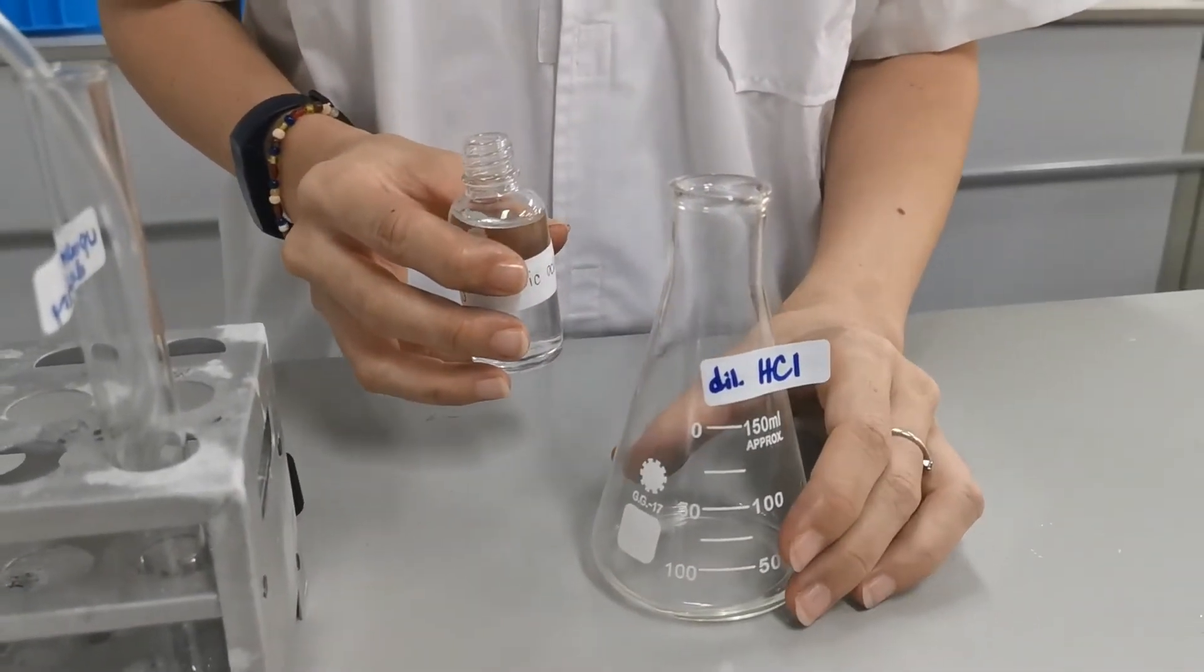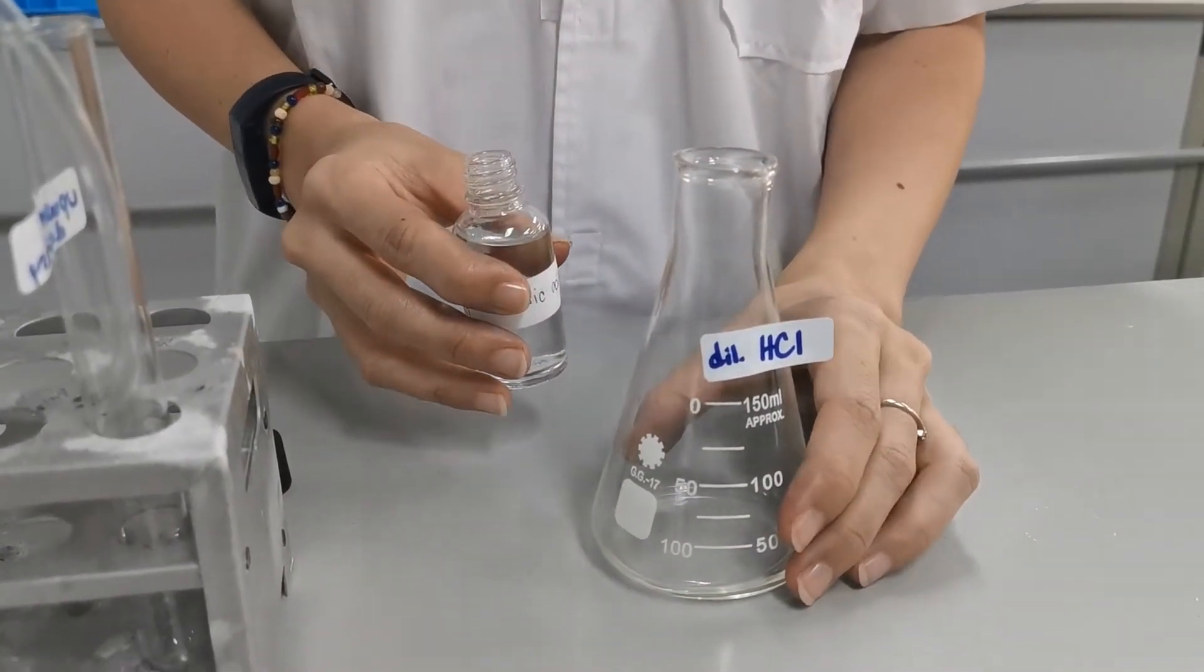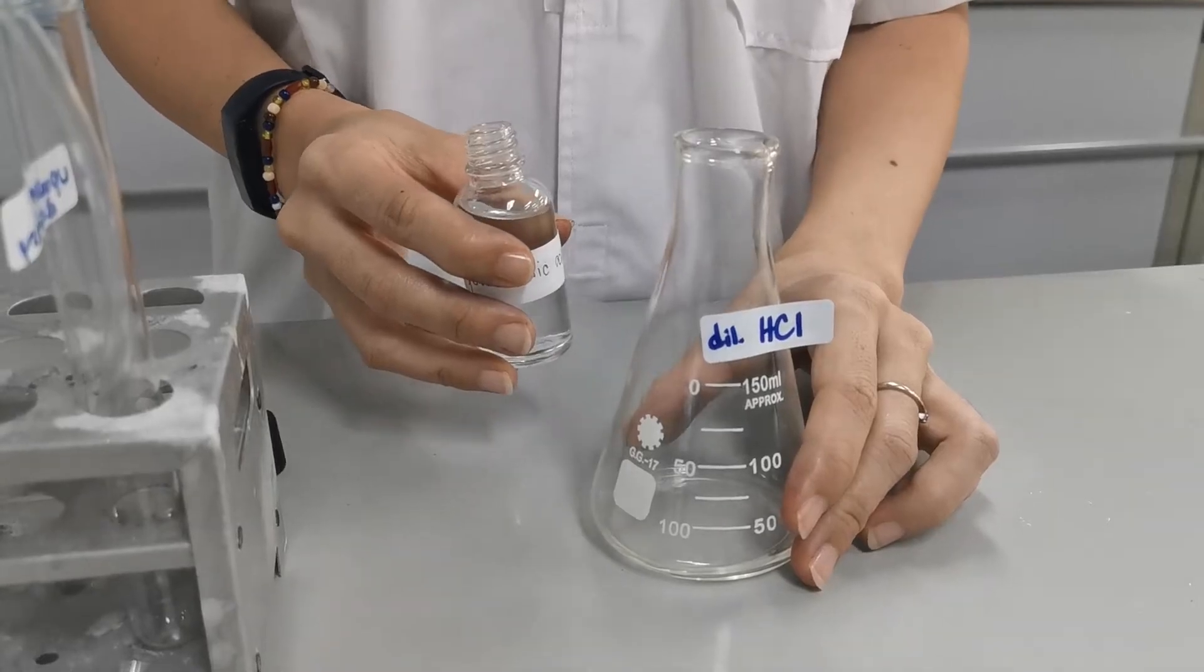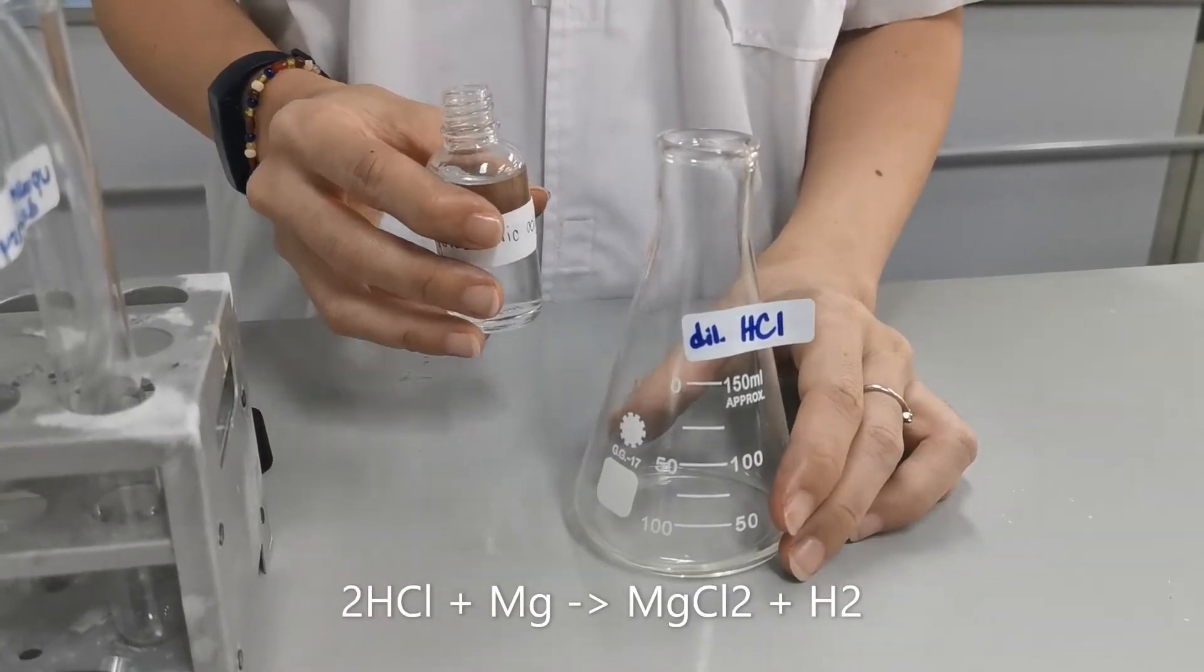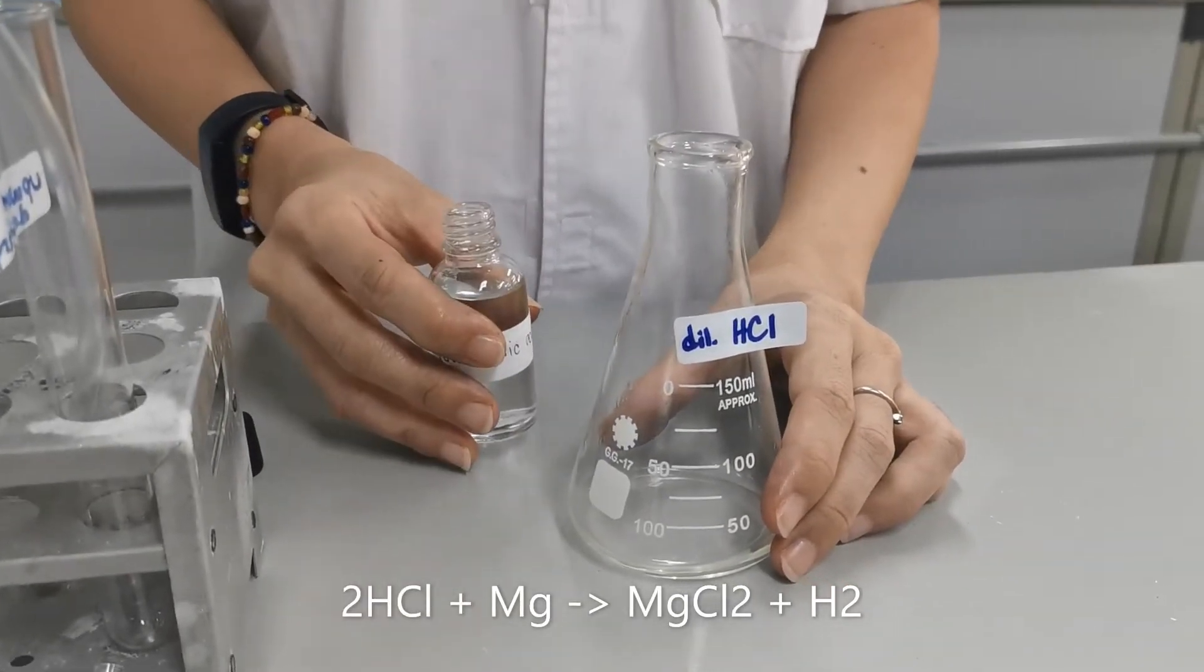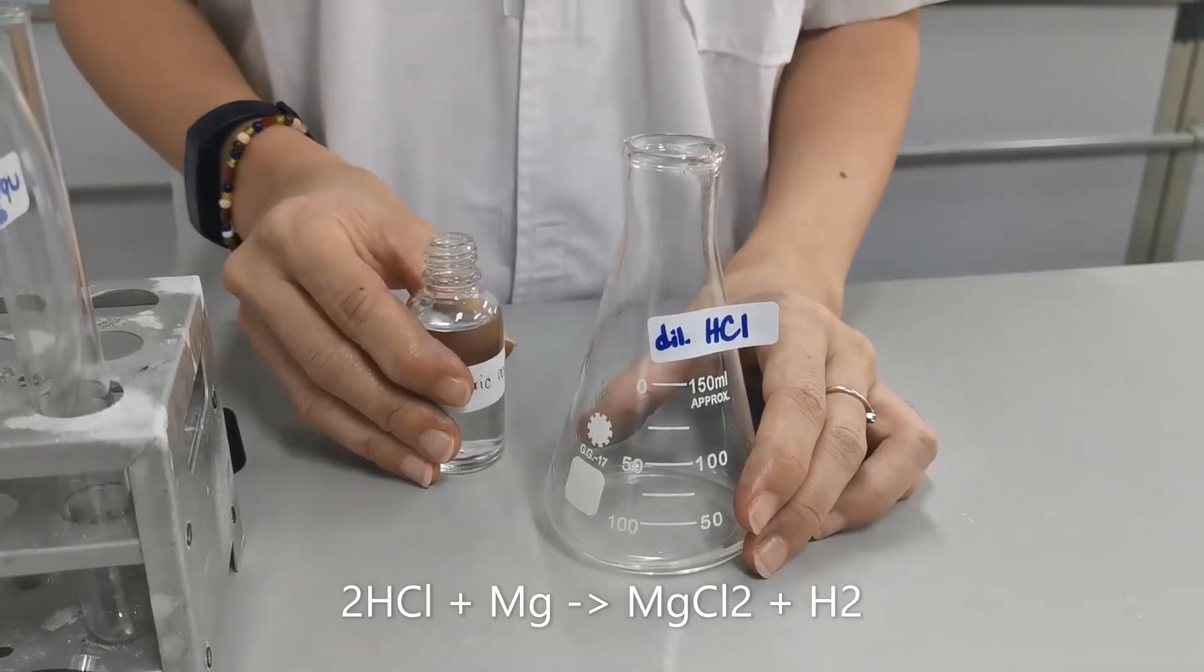As an example here, I'm going to react hydrochloric acid with magnesium and the gas produced is hydrogen.